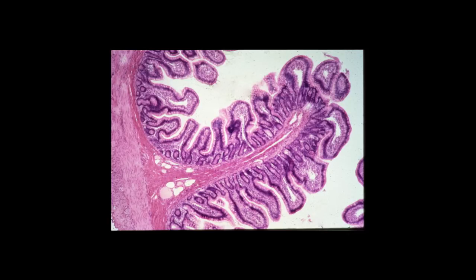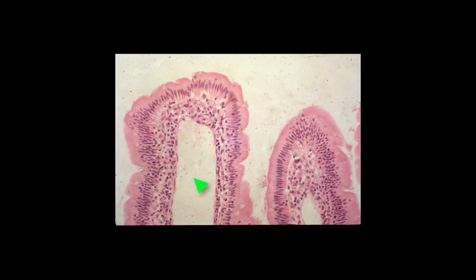Now, you can barely see at this low magnification some diffuse lymphoid tissue, some evidence of lymphatic vessels and lacteals. Lacteals are essentially large lymphatic capillaries that are found within the villi in the small intestine, and lacteals are usually fairly well distended in this type of preparation. They are often very well distended after an individual takes a large fatty meal. The lacteals function to transport chylomicrons that are absorbed in the intestine by the lymphatic circulatory system to the liver, where the lipids are metabolized.